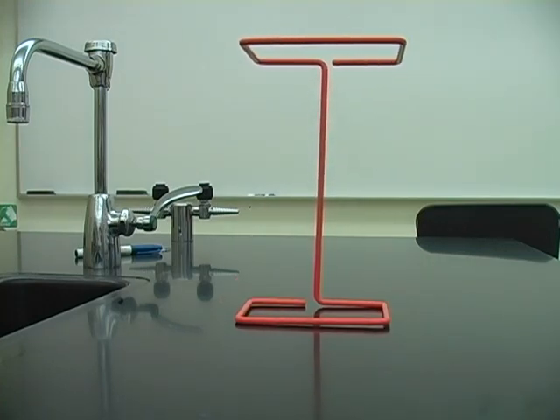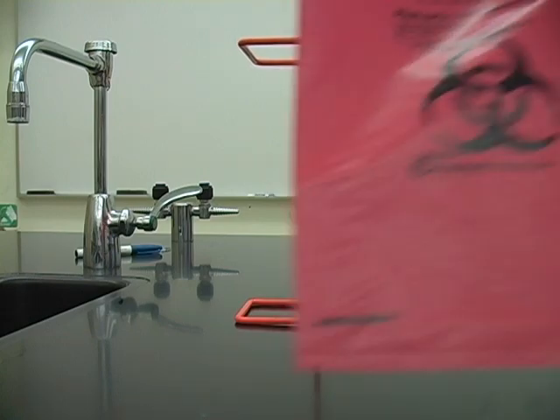Because we're working in a microbiology laboratory, some of the organisms we work with might be biohazardous. That's why we have these very convenient autoclave bags.